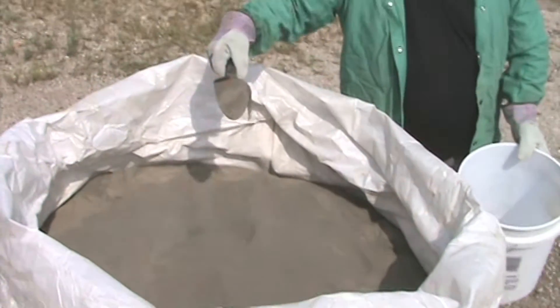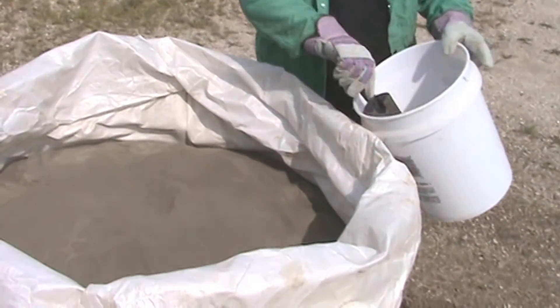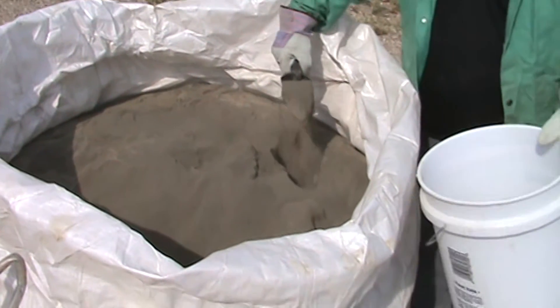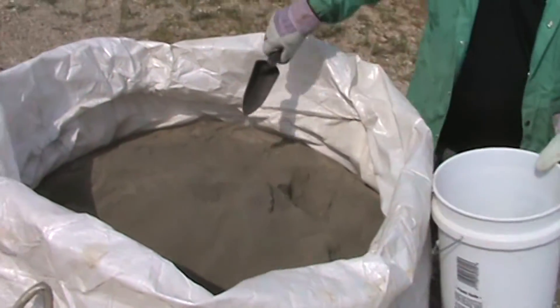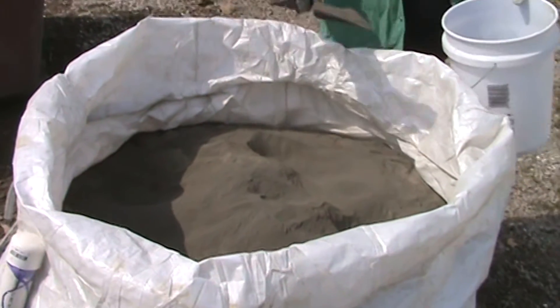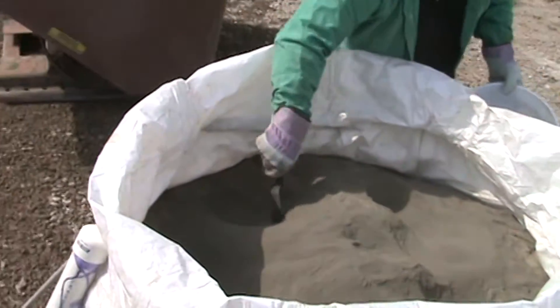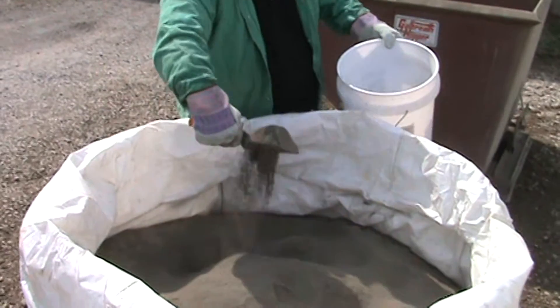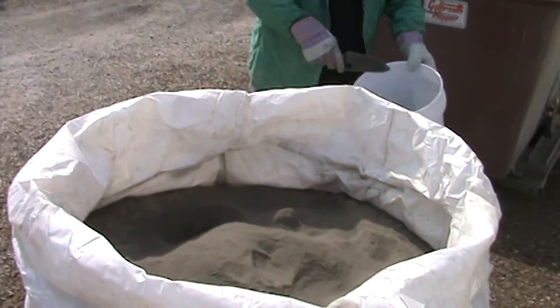The use of a simple hand trowel to collect samples from all areas of the waste pile, making sure to dig down as much as possible into the waste matrix. Pulling four to six small samples from the waste pile and mixing them together will help ensure a representative sample of the entire waste pile.